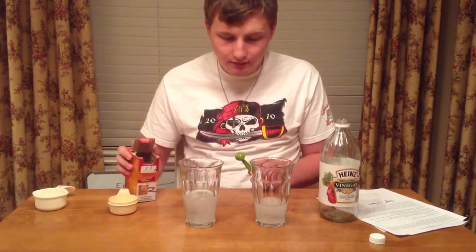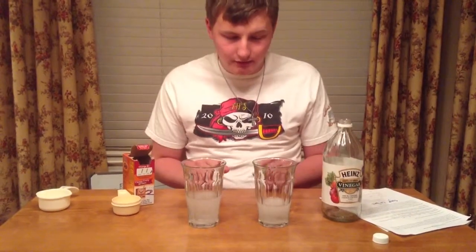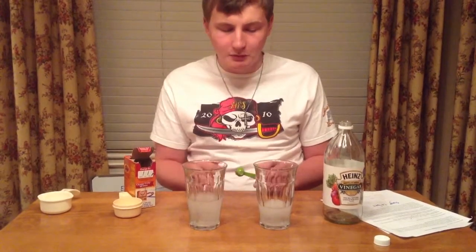Each of them reacted pretty quickly, but if you could tell, the water, since there was more to begin with, it didn't foam up as high.